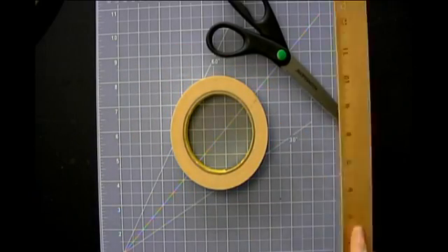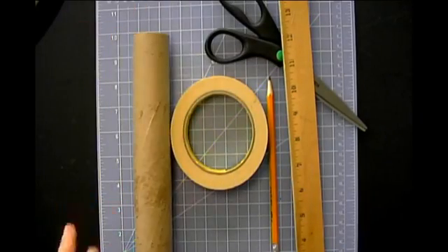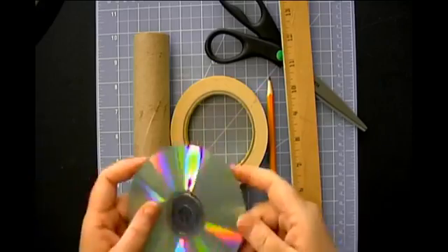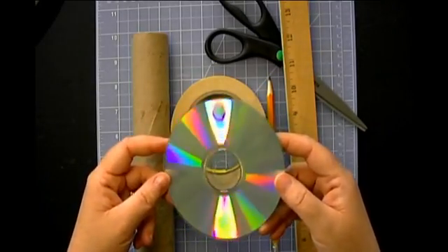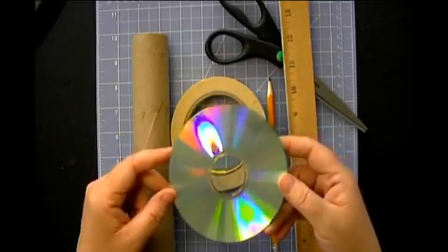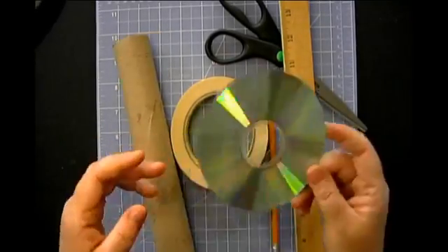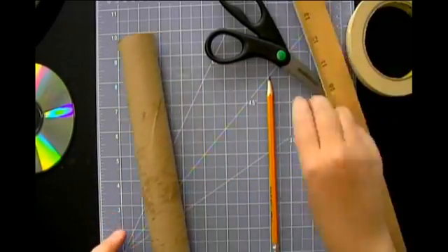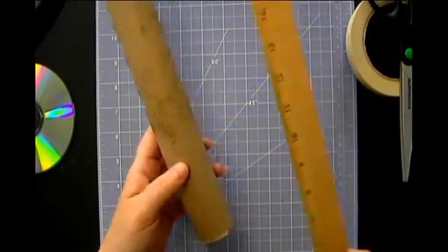Tape, ruler, pencil, my tube, and my CD. All right, and you can even see, look at that. It's already refracting light. See how it's breaking up the light already? Just even hanging these, like paint this side, hang these outside, makes a really nice mobile. It's all shiny. Okay, so we want to do a quick bit of measurement.